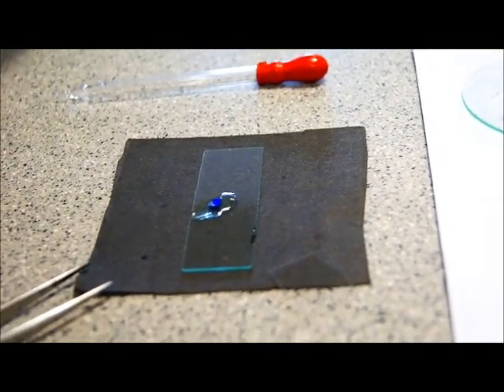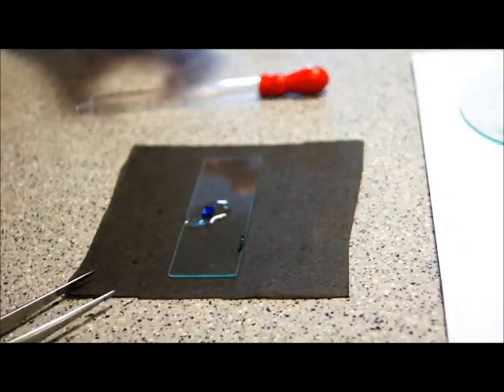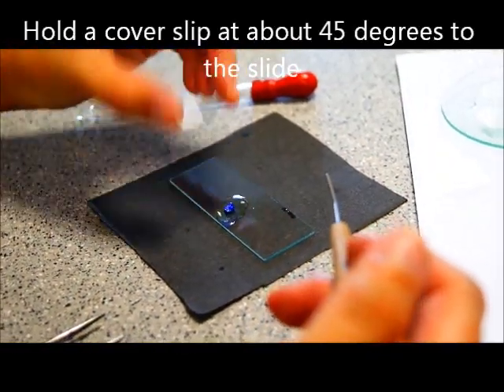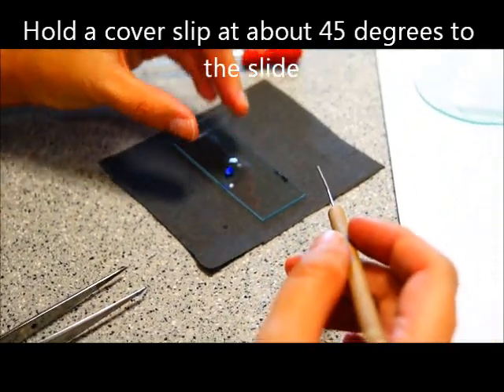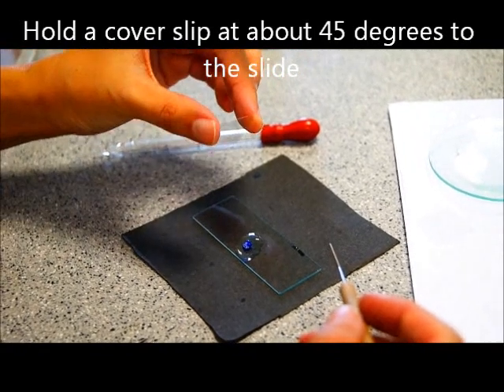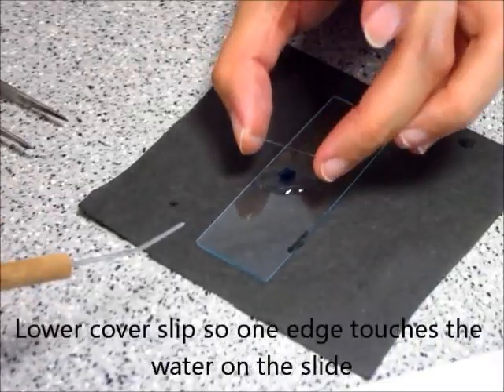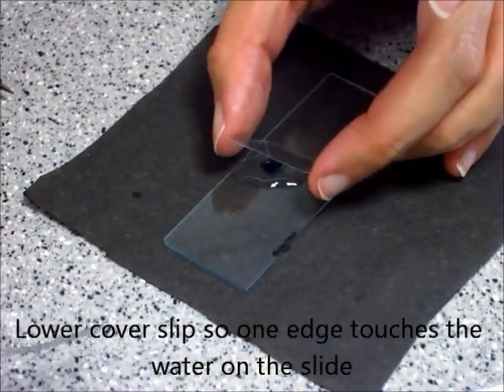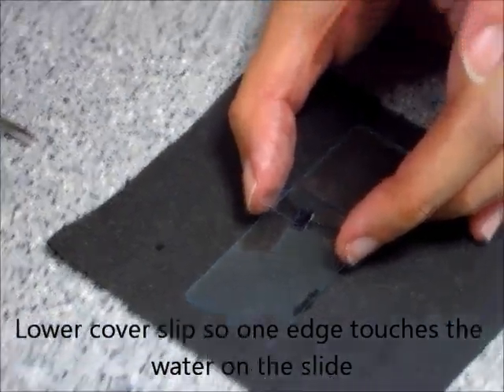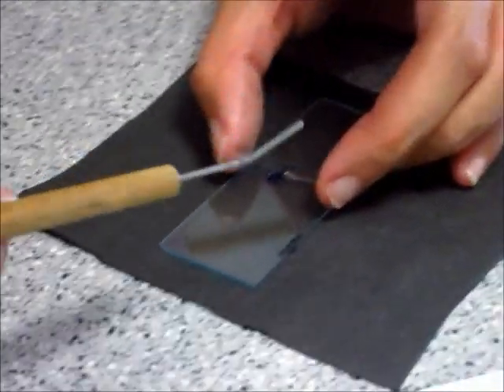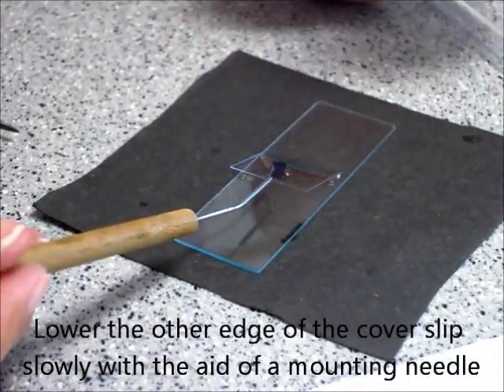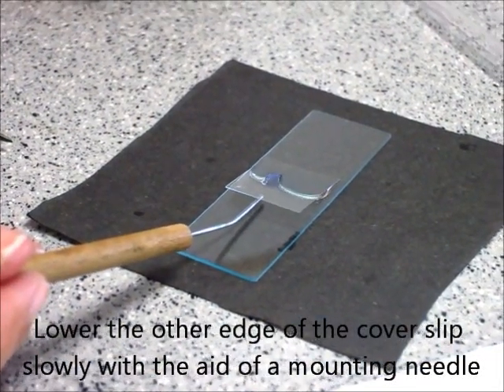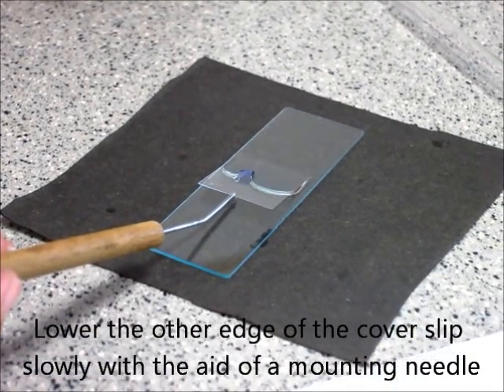First, what you need to do is to angle. You don't drop the cover slip straight on the sample yet. You angle the cover slip about a certain angle, 45 degrees maybe. And put one side of the cover slip against the center part of the slide. You can see all the water gathering there. And with a mounting needle, you rest the other edge of the cover slip on the mounting needle and you lower it gently and slowly down to prevent the formation of bubbles.